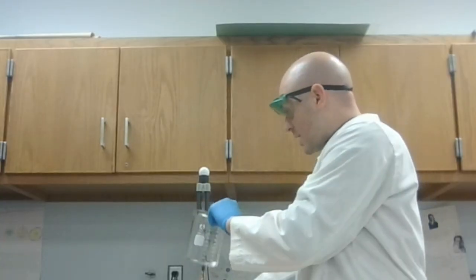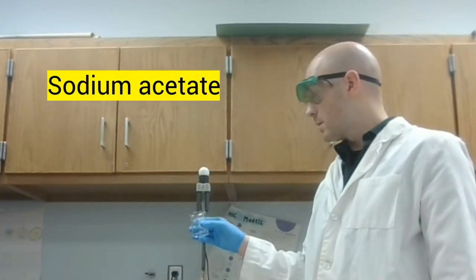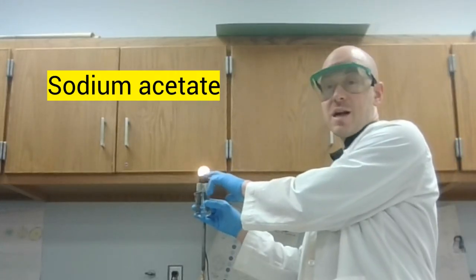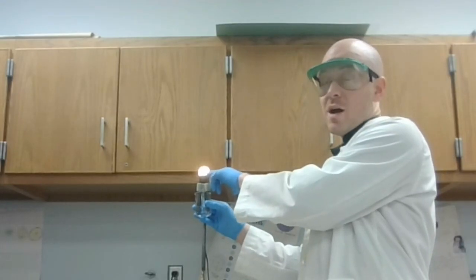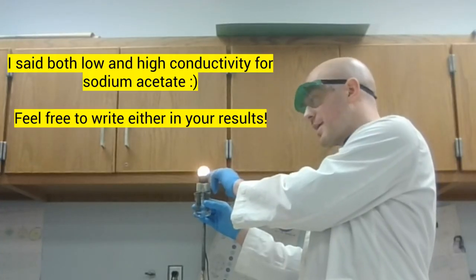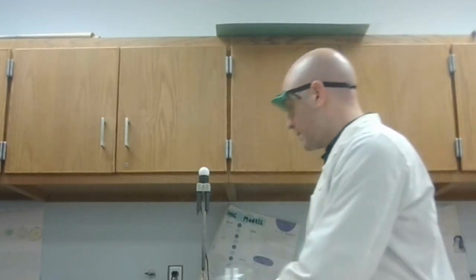And our very last sample, our sodium acetate. This has a low conductivity. It's not quite as bright as the last one. It's kind of on the edge. You could honestly say low or high. It's definitely conductive. For this one, I'm going to go ahead and say high conductivity. It's a little bit lower than the calcium chloride, but still conductive. So that sodium acetate had high conductivity.